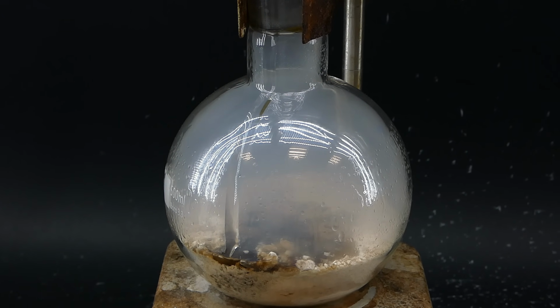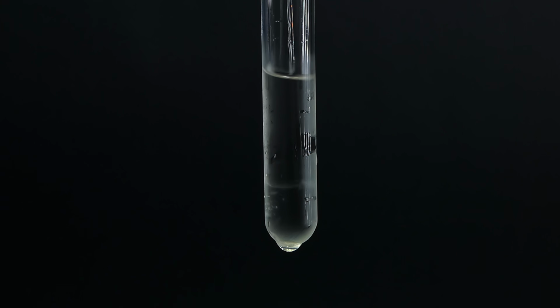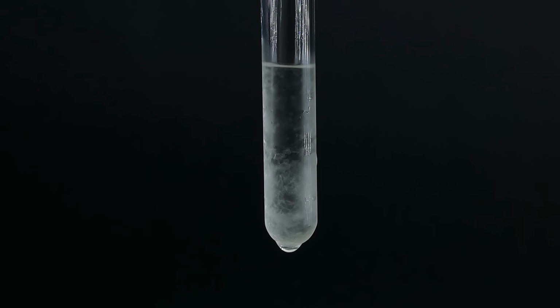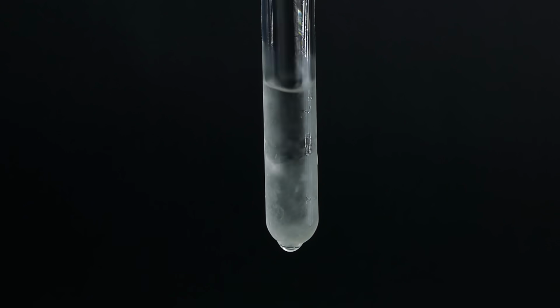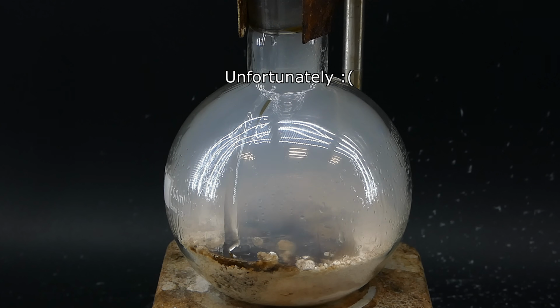So in today's video, I will be turning some household vinegar into glacial acetic acid, which is an extremely useful chemical, and I will use it in a lot of future videos to make all kinds of cool stuff. Before I start making it, let me give you some background on what glacial acetic acid even is, because even though the name suggests it, it has almost nothing to do with glaciers.